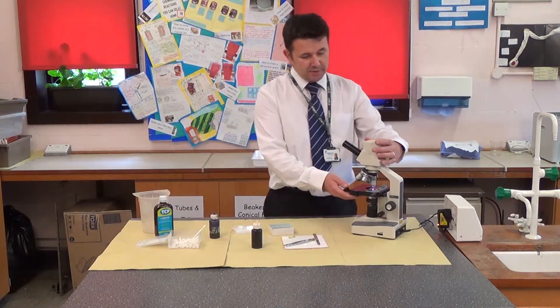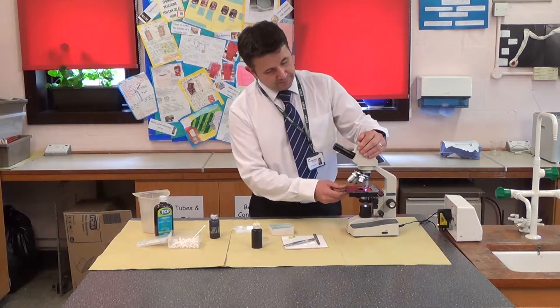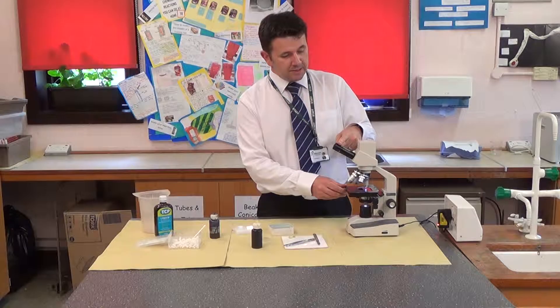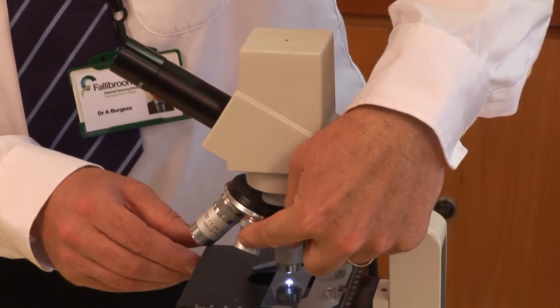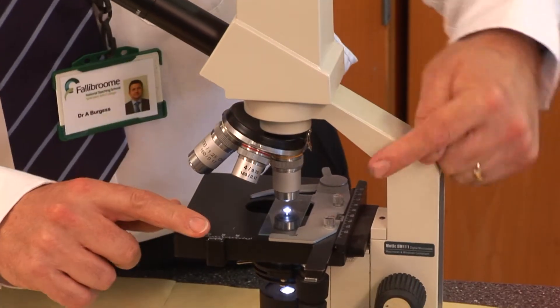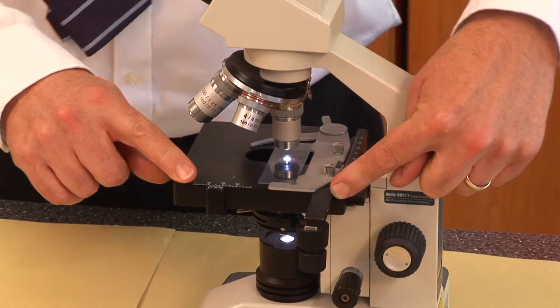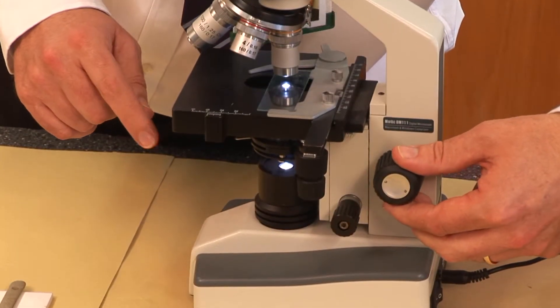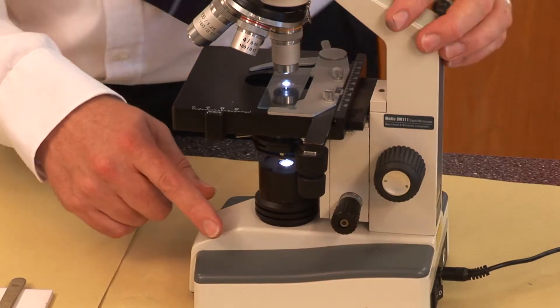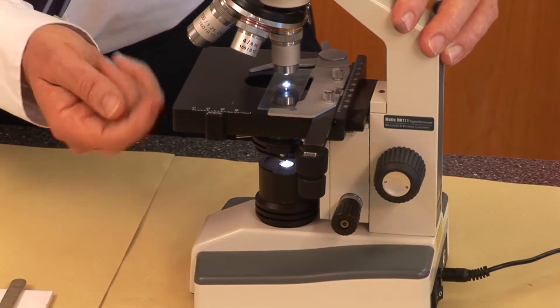Just a few things about the microscope first. The microscope has different parts to it. You have the eyepiece, then the objective lenses, and the stage. This is where you put the microscope slide. Then you've got what we call a coarse adjustment and a fine adjustment. Down below we've got the light that is shining up through the specimen.